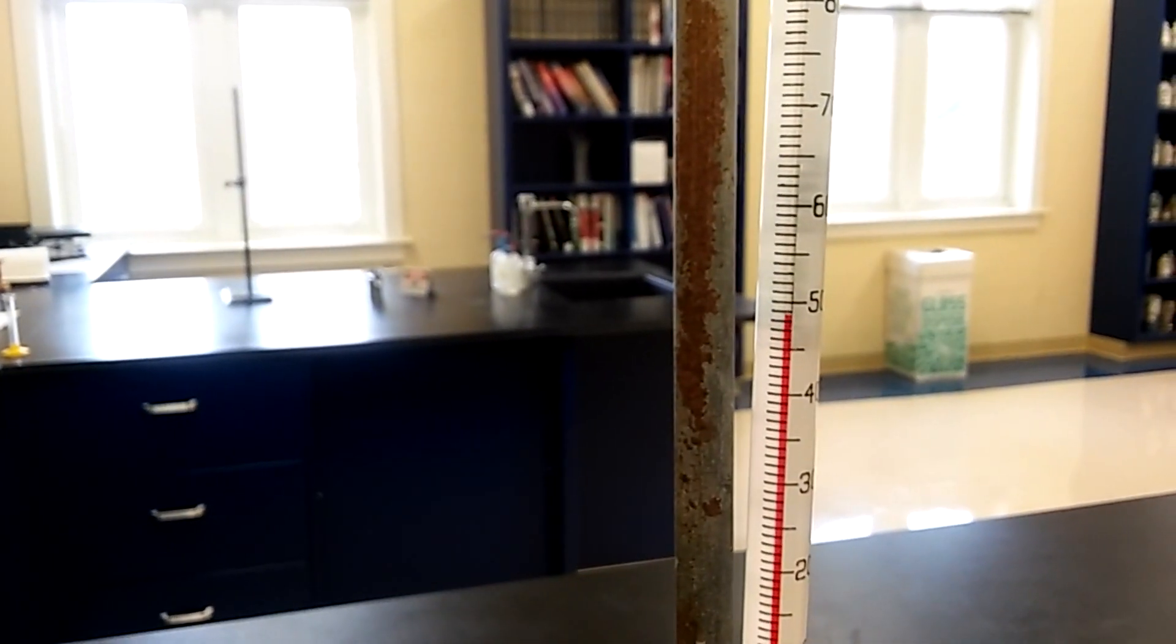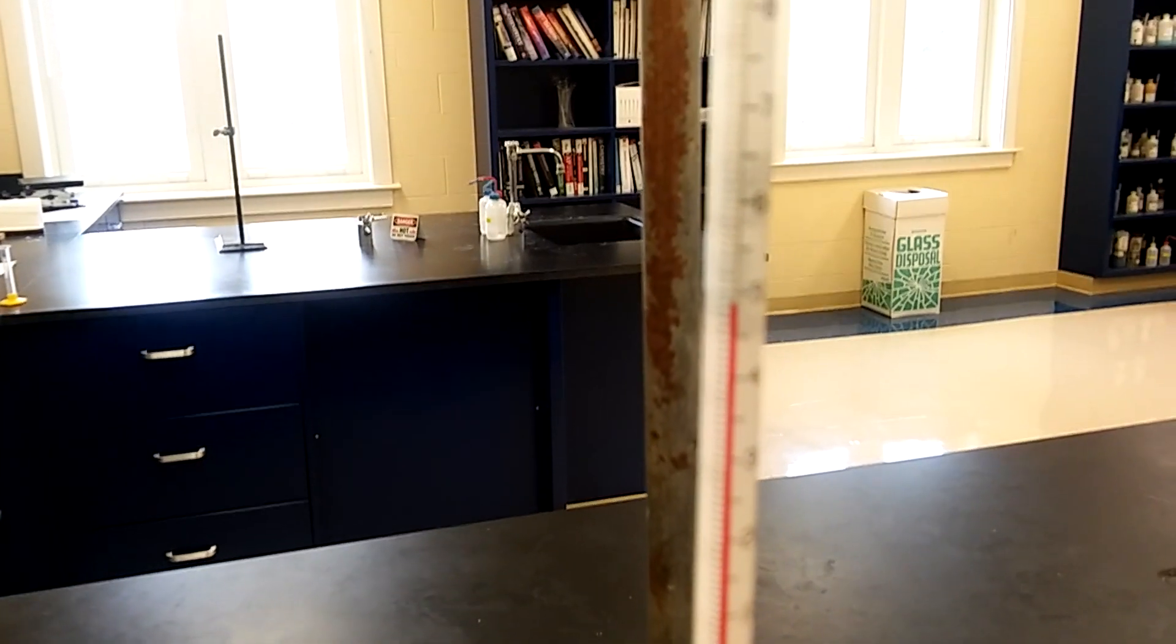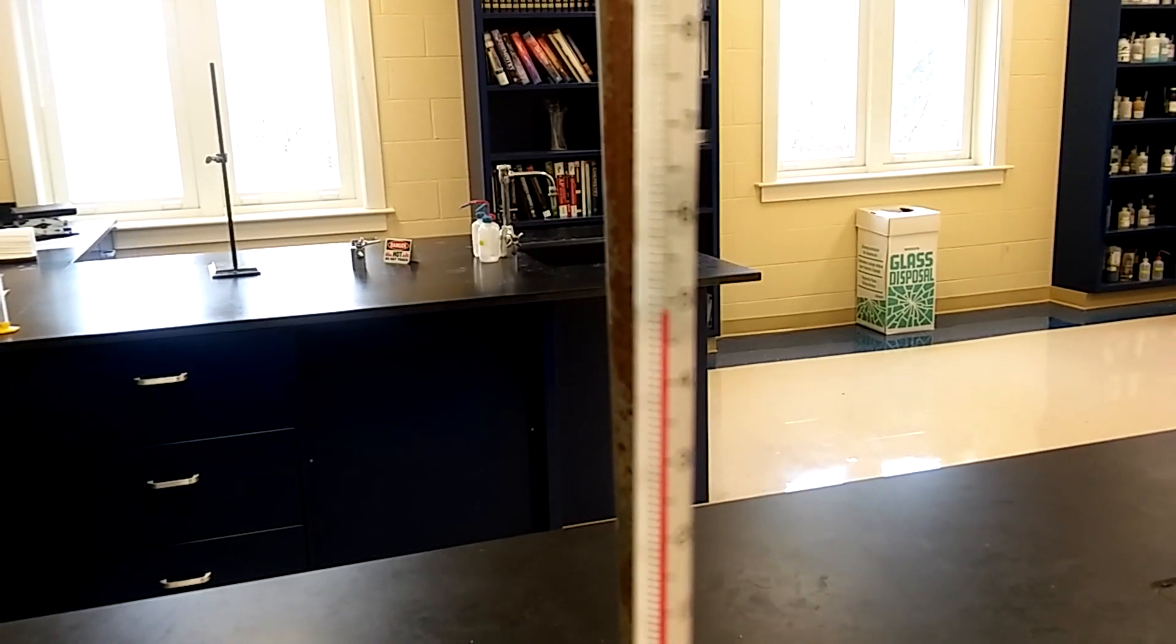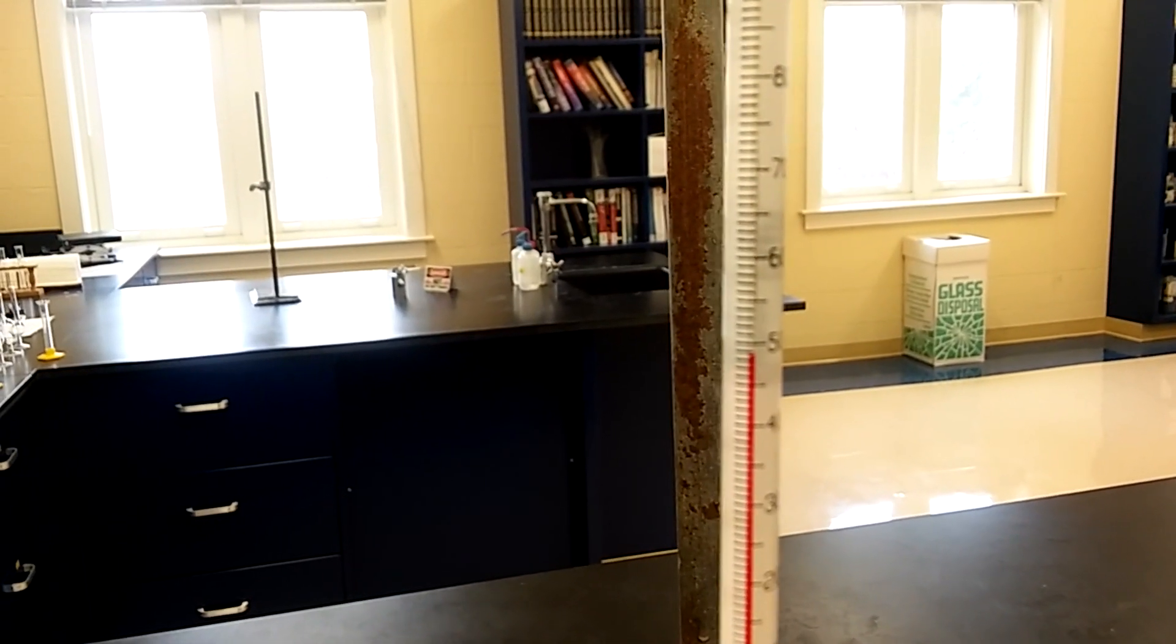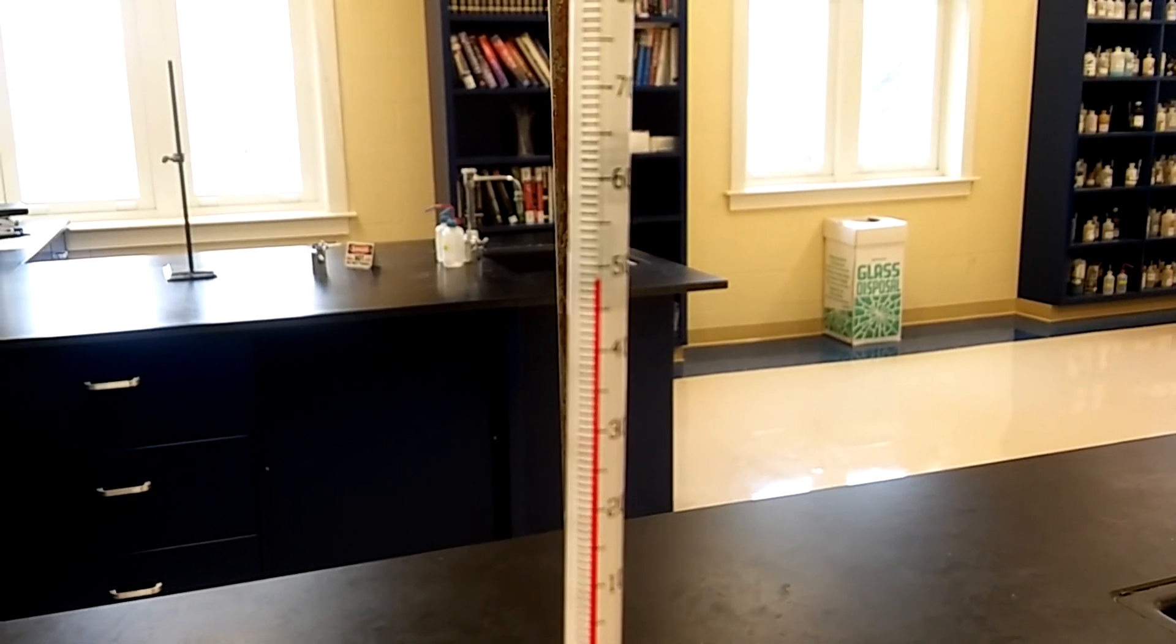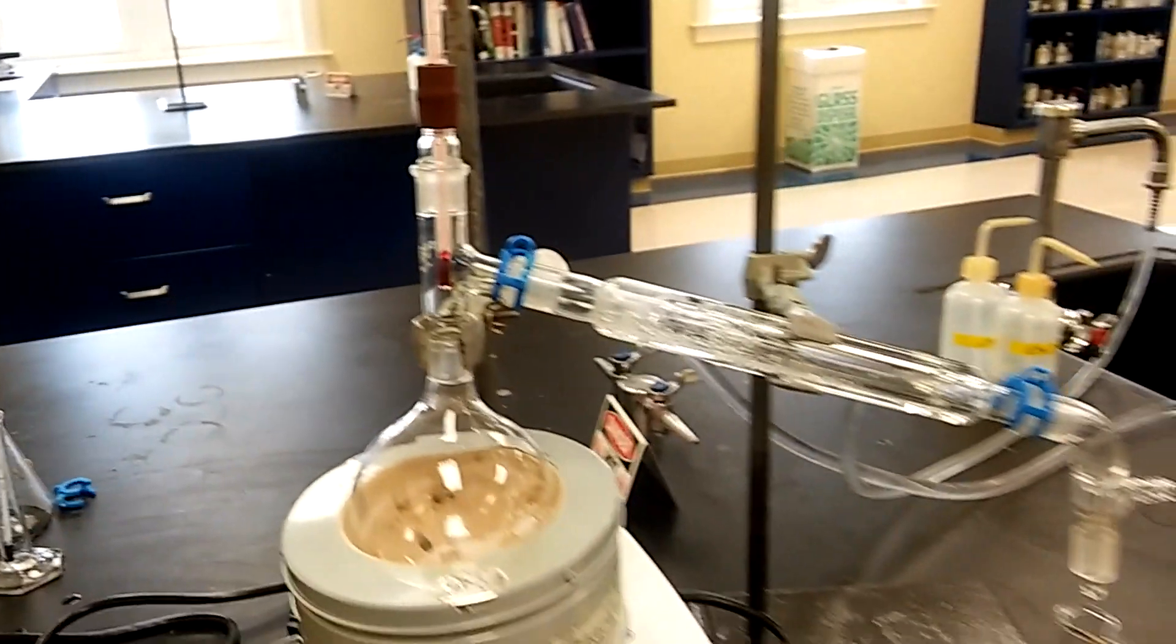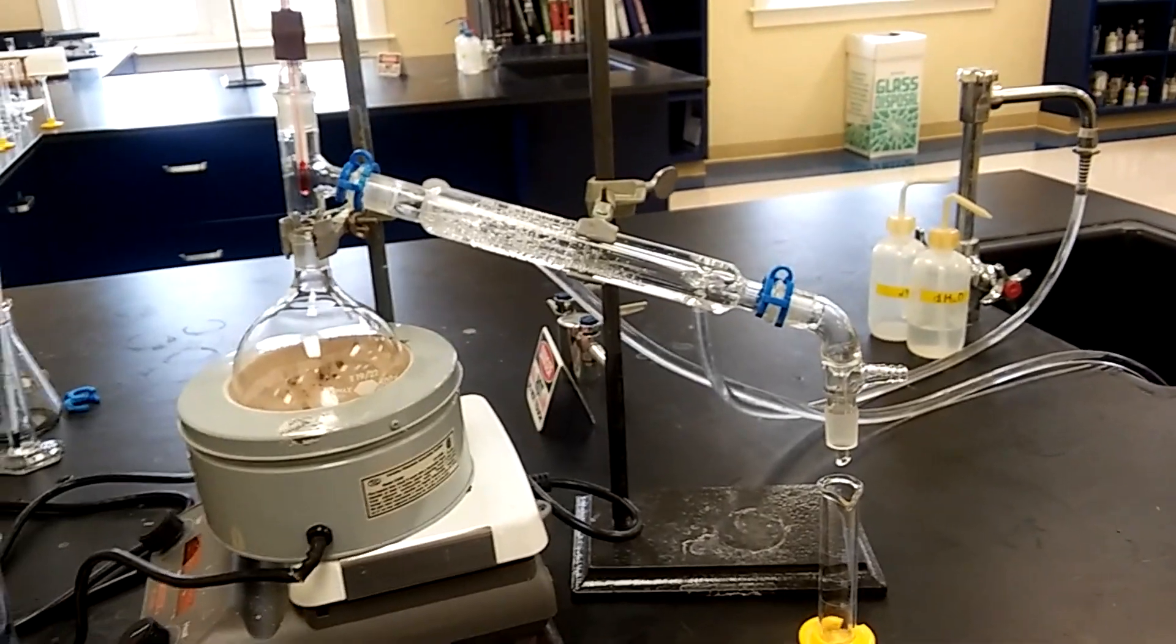We're at about 49 right now. It's gonna stay there for a little bit because we got a lot of vapor coming through. When it gets to 52 I'm going to shut off and show you the final yield. That's the end of t-butyl lab - simple because I did it in an organized manner.